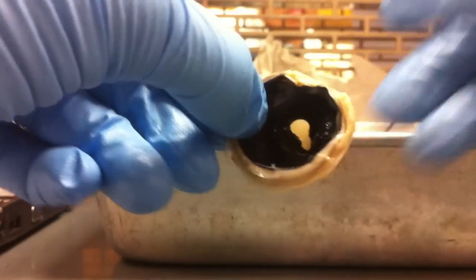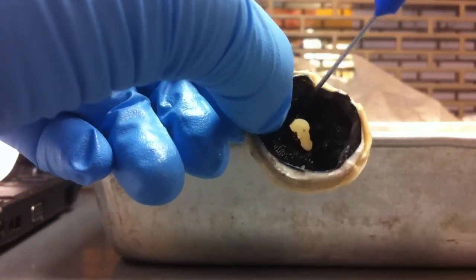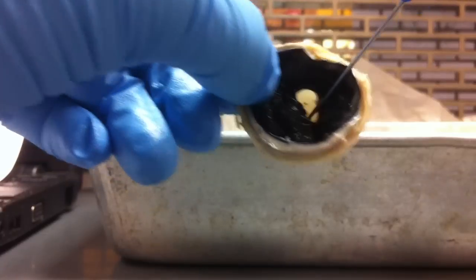This is the anterior portion of the eye. The space between your cornea and your iris is the anterior chamber.